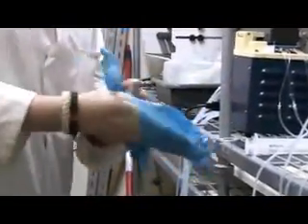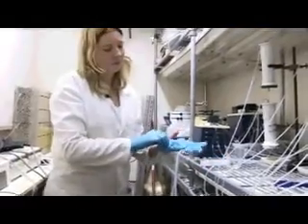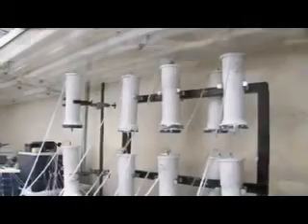Basically, what you have here is quite obviously a column experiment. What I'm trying to work out is what effect retention time has on the ability of my material to remove nitrate pollution.